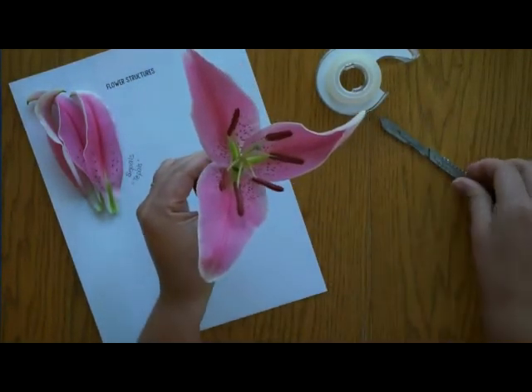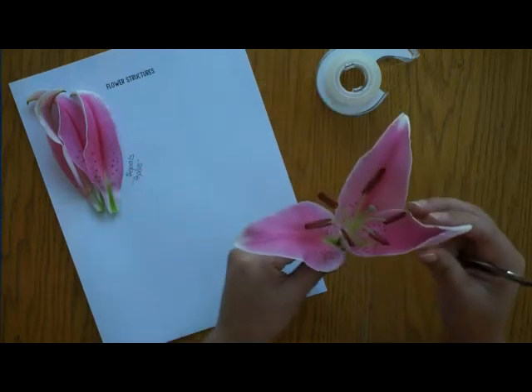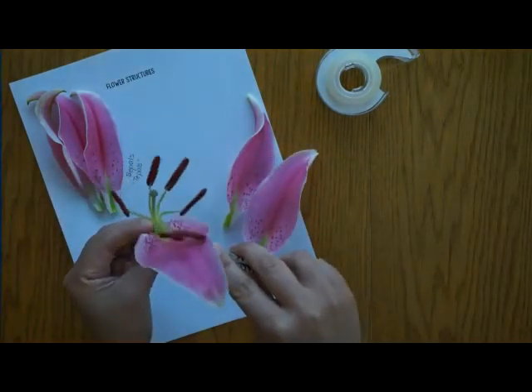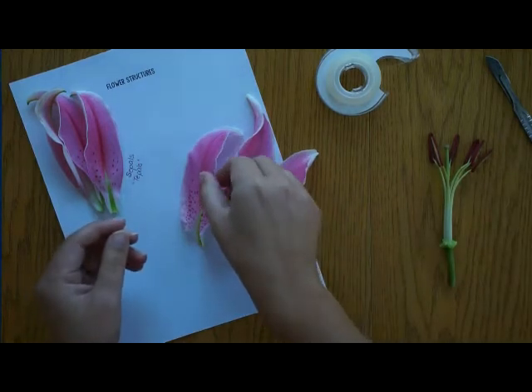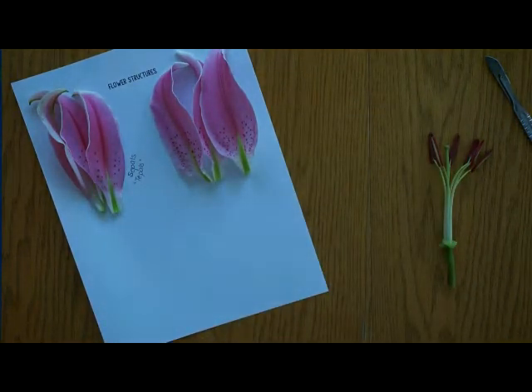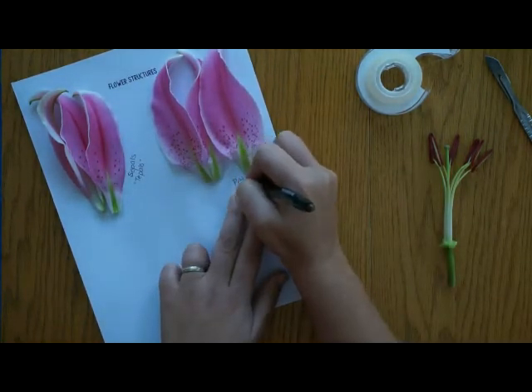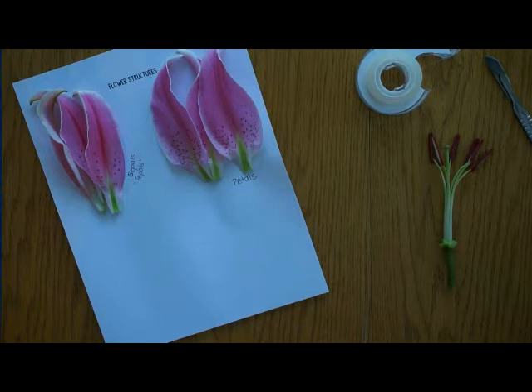The next step is to take off the petals of your flower. Remember to be very careful with your scalpel — especially if it's new, it can be very sharp. If you want to use scissors, that works fine too. We're going to take off our petals, and you should read the function of petals on your lab procedure. Then take those petals and tape them down onto the paper. You can see there is a little bit of a difference between the sepals and the petals on the lily, although they look a lot more similar than on many plants. Then label those once they're taped down, and don't forget to do your observation page.